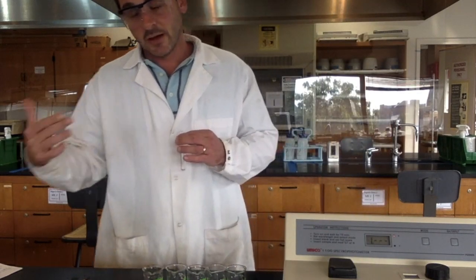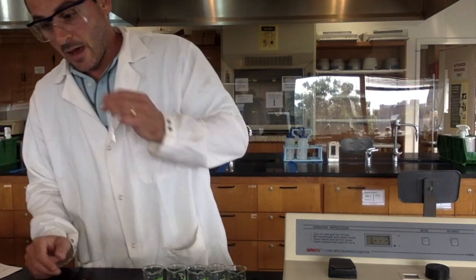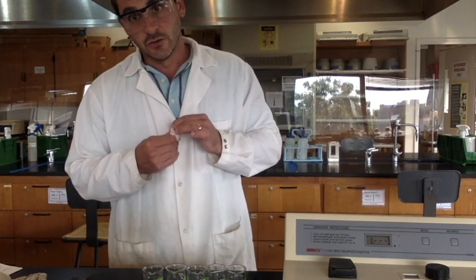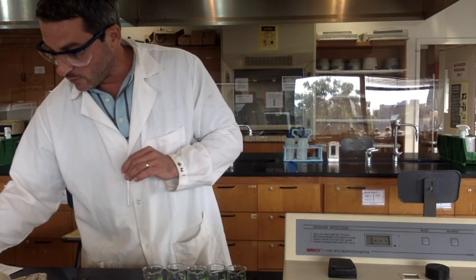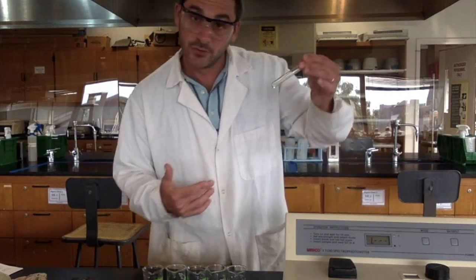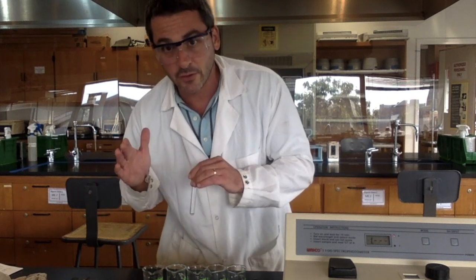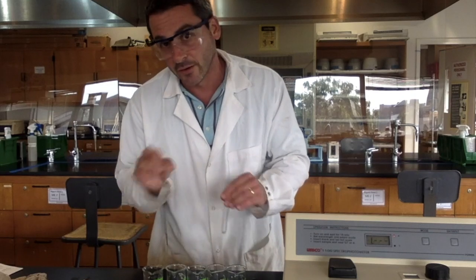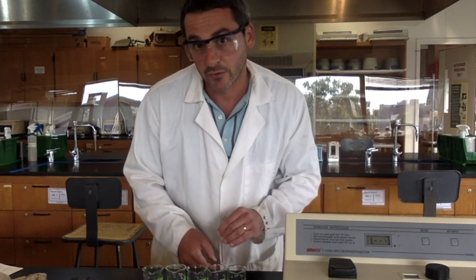You want to use the same cuvette to keep your readings consistent. So I'm going to dump out my distilled water, and I'm going to start with the solution that has the lowest concentration. So I'm going to start with E. That way, it's hard to completely empty the cuvette. I'm going to show you what to do here, but you want to always start with the solution with the lowest concentration. That way, if there's a little bit left over, accidentally, it doesn't affect your results as much as if the concentrated one was in there.